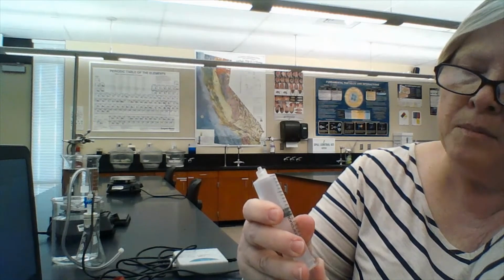Now I'm going to be doing this lab, and the first thing we're going to do is put the syringe at 10 milliliters. Now, inside the gas probe, there is 0.8 milliliters of dead volume, so we're going to add that each time we check the pressure. So the first pressure we're going to take is 5, and I'm going to press collect on the computer, and you will get a copy of the data.